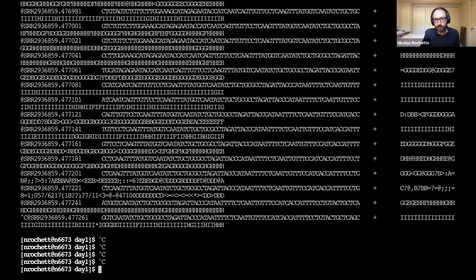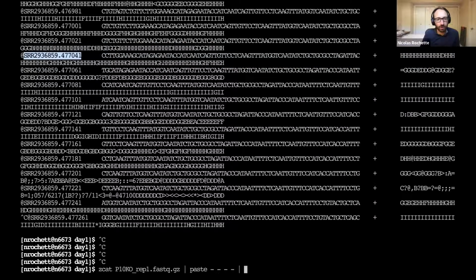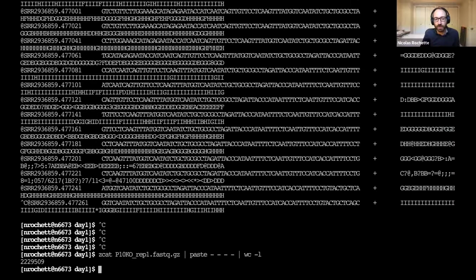So this is taking all the reads, with one read per line here, where we have the ID, the sequence, and then the qualities. And just counting how many lines we have. And that gives me the number of reads.